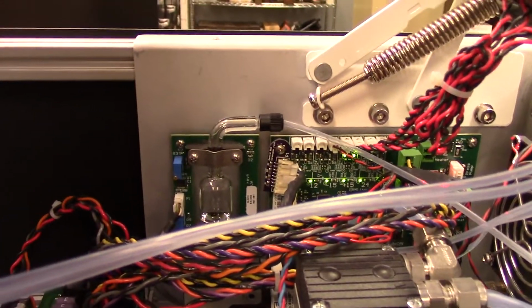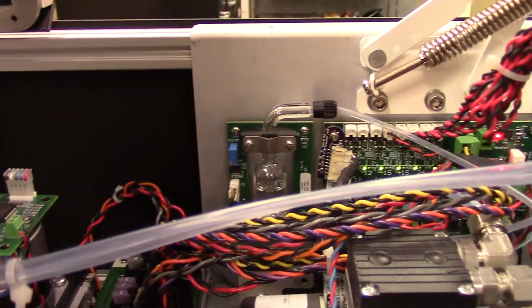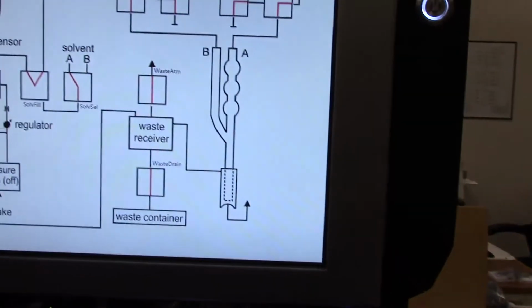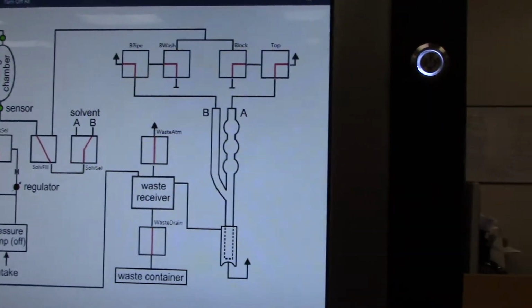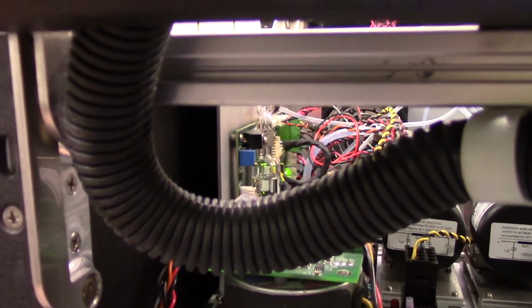We turn it on, watching the dosing chamber. If we stop too low, the top sensor is not covered. Okay, this is the problem. We come back. We turn it on again. Watching in here, we have to turn it off very quickly.